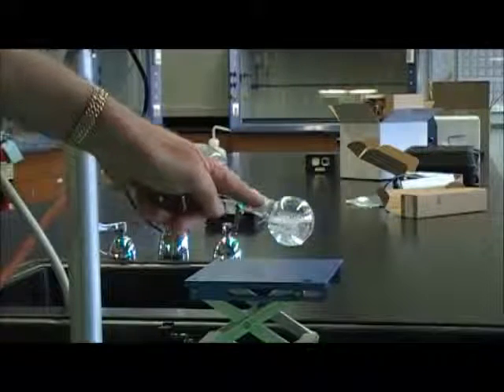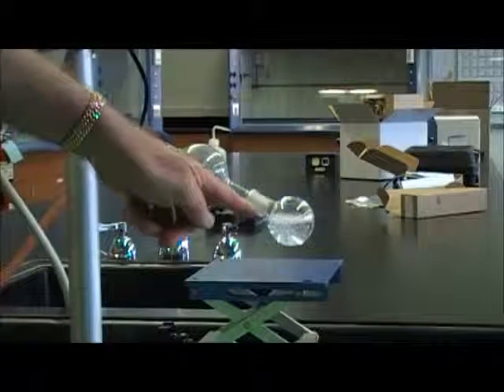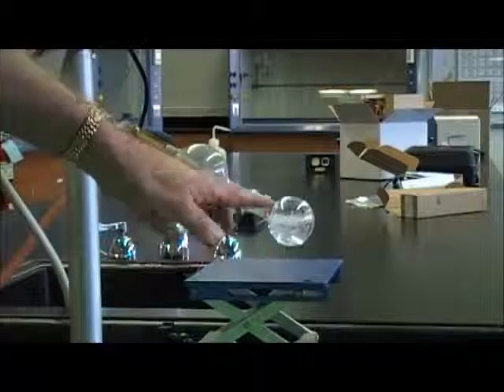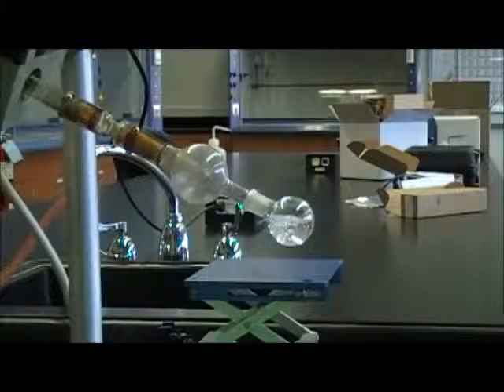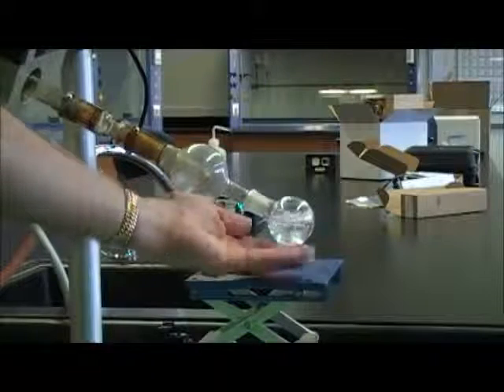And you can see that there's bubbles forming in there. In other words, that solvent, which happens to be ether, diethyl ether, very volatile solvent, is literally boiling in this flask even though there's no heat.